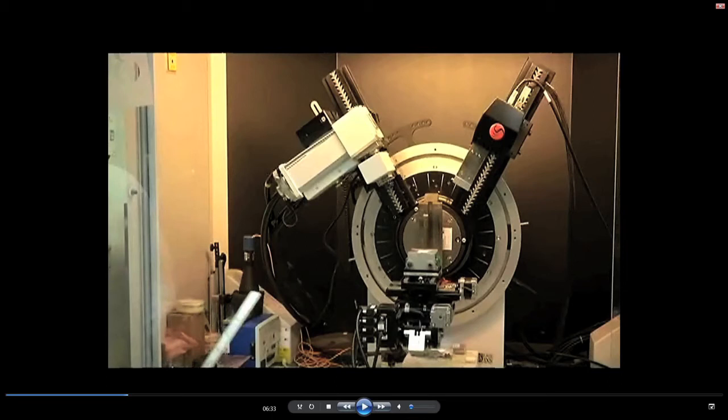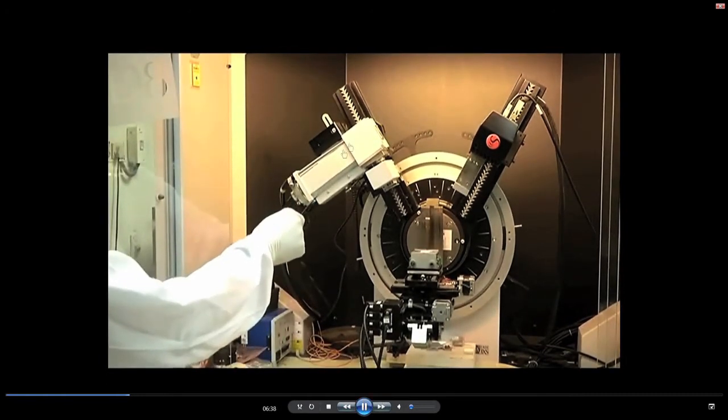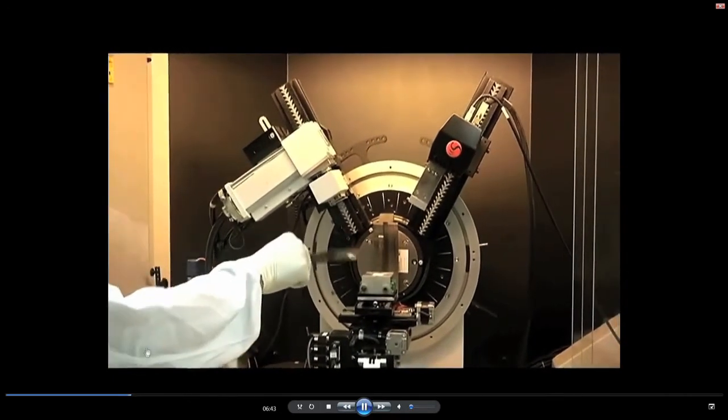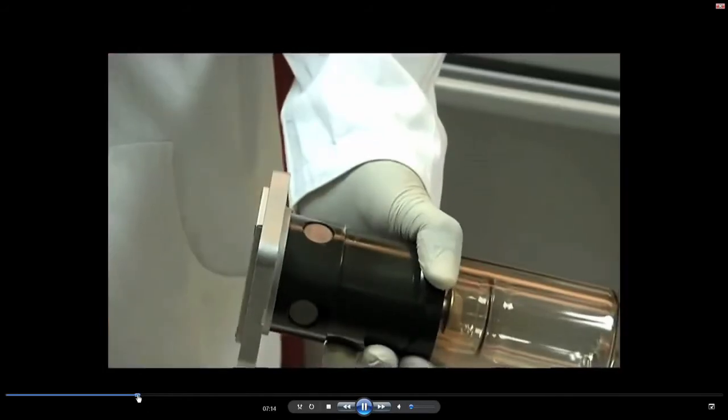Right now it is small because the 2 theta is here. This is the sample, you draw a straight line, and this is the diffracted beam. So, this angle is 2 theta. That is going to vary, and you see that the focusing circle is also varying. Now we will look at much more detail about this. This is about the basic components of the diffractometer. We will now show some of the important components here.